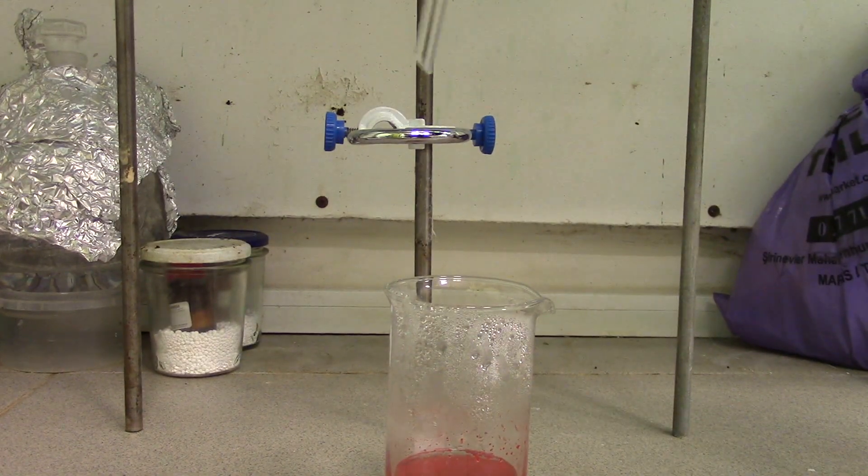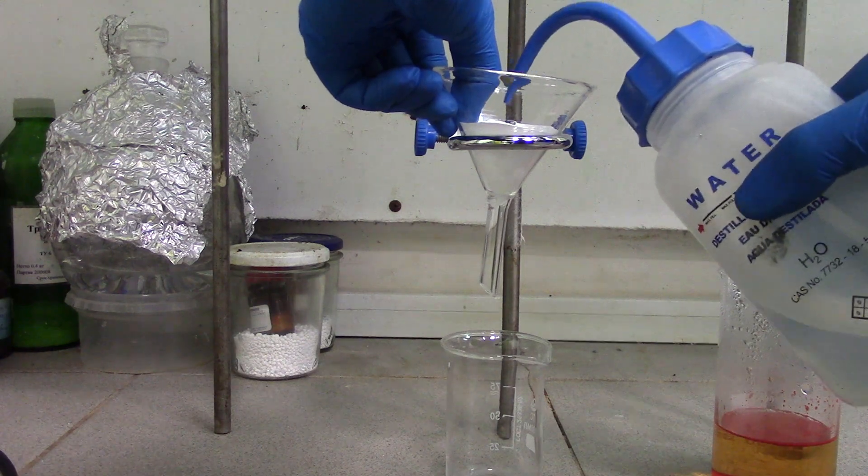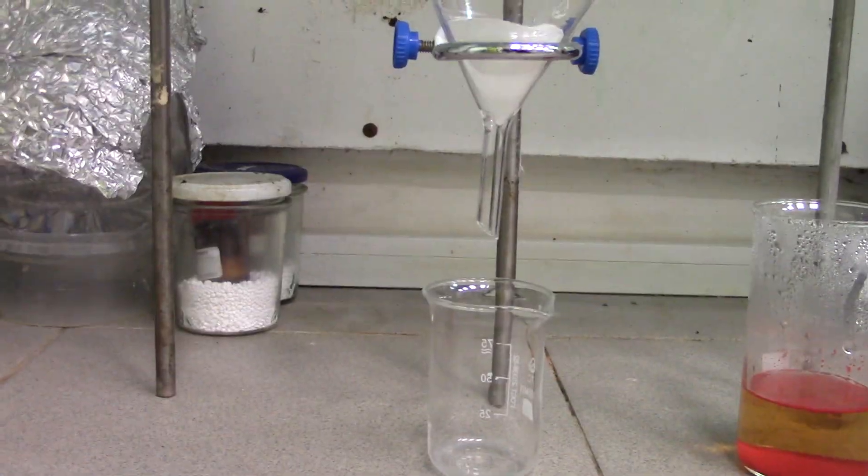After reaction completion, the red precipitate of potassium hexachloropalladate was filtered off and washed by cold distilled water.